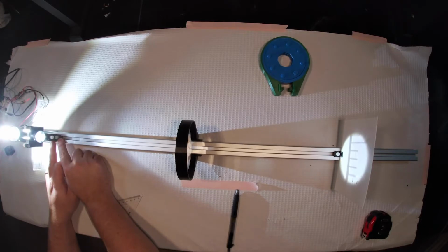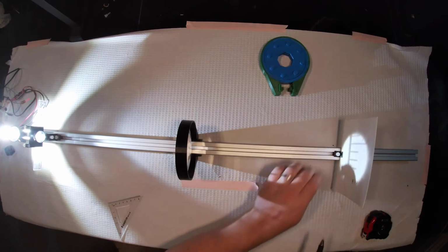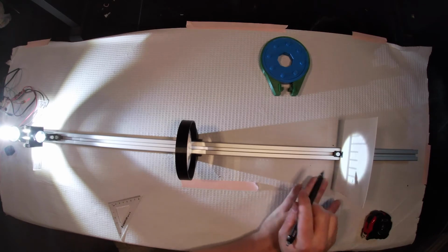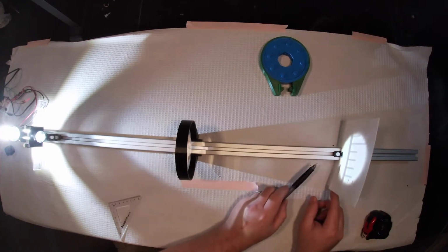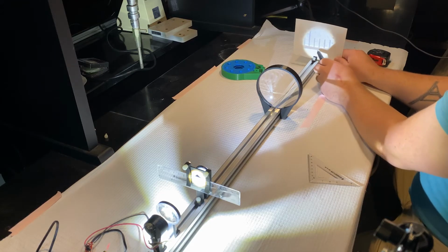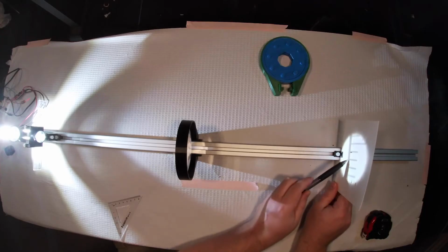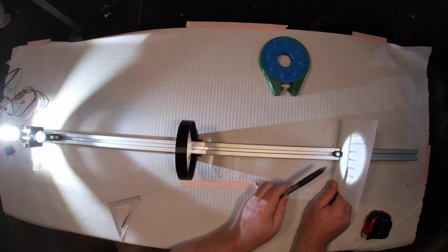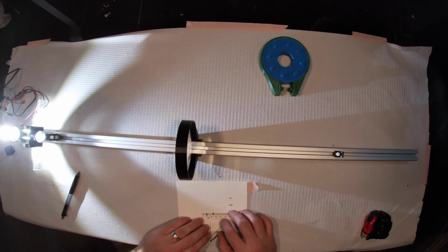This will make the math very easy, because what I'm going to do is make sure that we lock this sample plane down. And without moving the image very much, I'm just going to make a mark in the center of one of the ticks, and then a mark in the tick next to it. So I'll take these 2 marks and I will do a quick measurement.